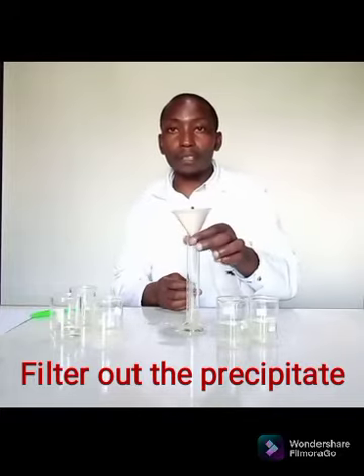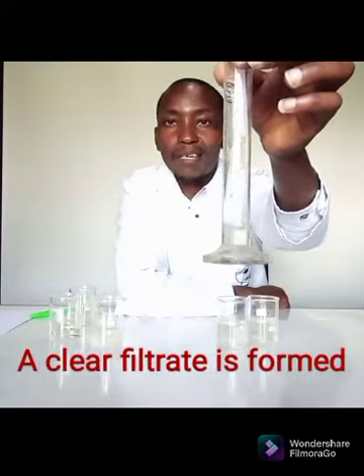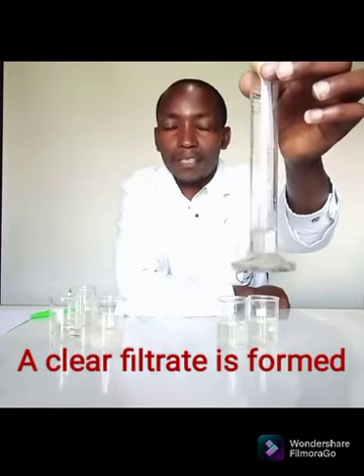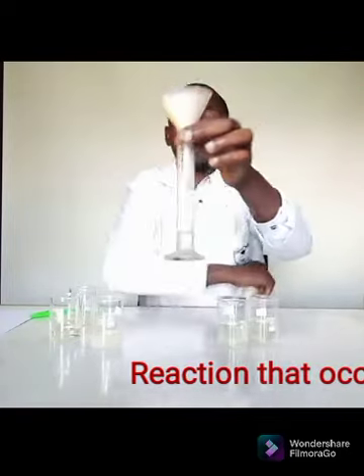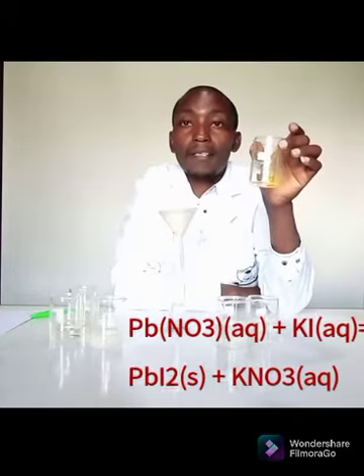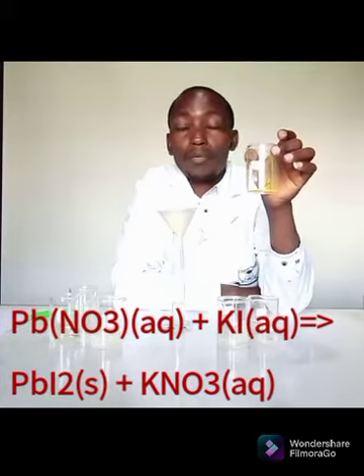One thing you will notice is that the solution that is coming out is very clear. So what reaction occurred? We need to ask ourselves what reaction occurred. When I mixed lead II nitrate with potassium iodide, I expect the double decomposition to occur.